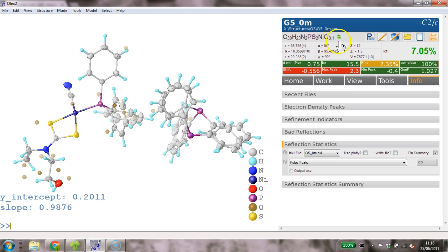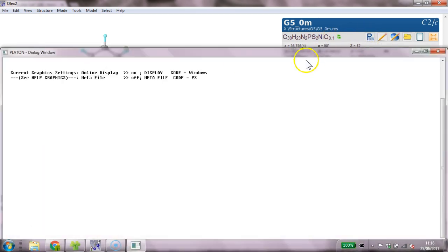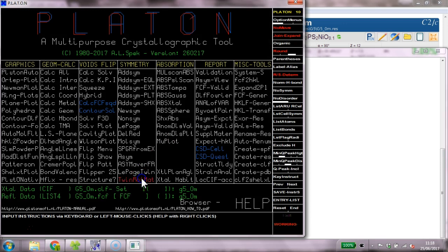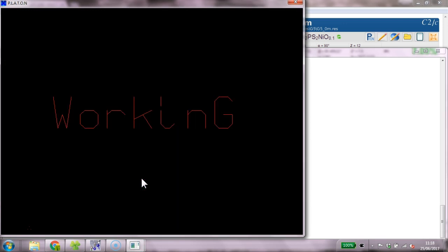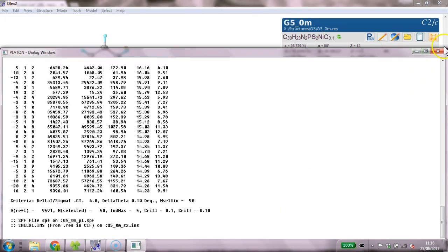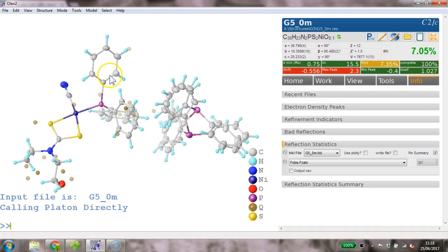We could also check PLATON quickly, so we click on the PLATON button up here, and then wait until PLATON loads up. TwinRotMat is a quick one to see whether it finds any twinning, but it won't. No, okay, there's no twinning detected here. So I've got no answer about this peak at the moment.